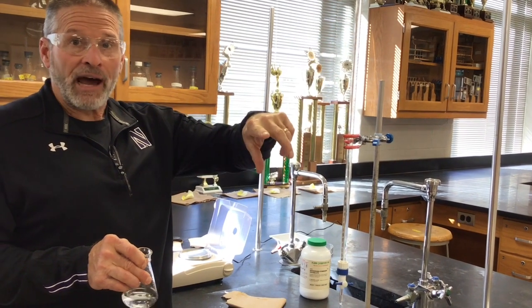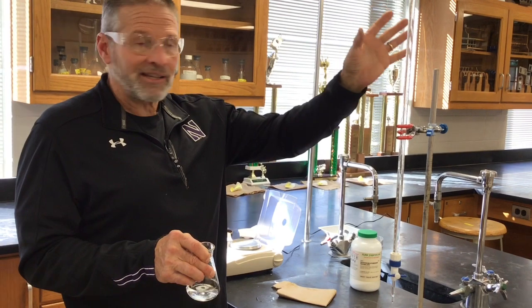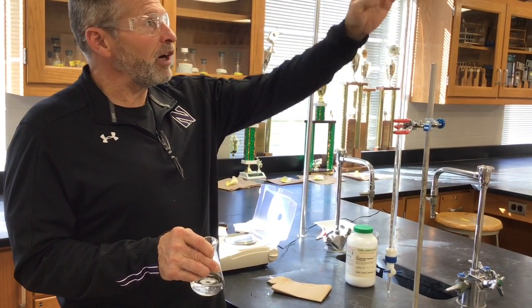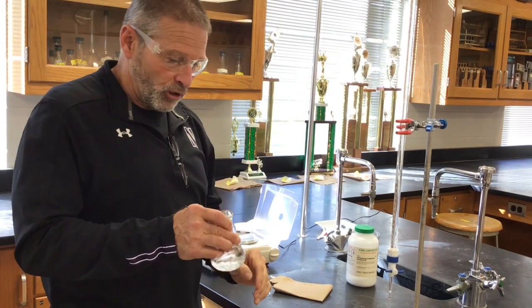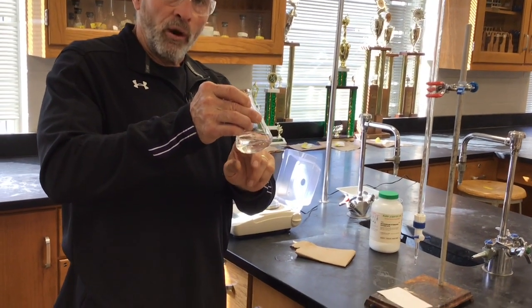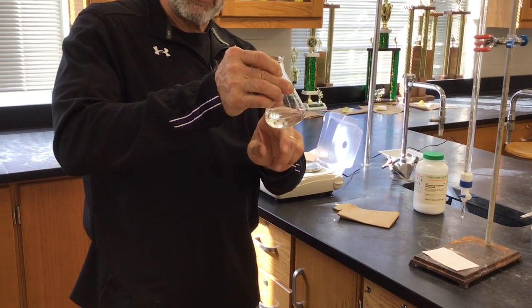But you've done that now. You know the molarity of this NaOH. It's the exact same NaOH solution. So now you know this molarity. The burette's going to read the volume for you. The question now is, what is the molar mass of this unknown acid?